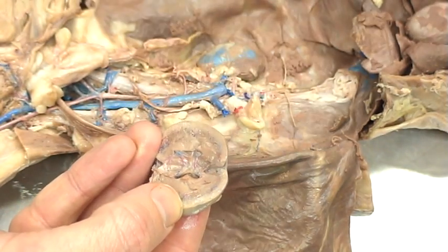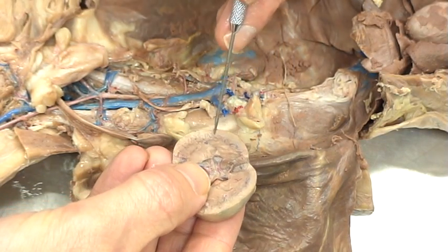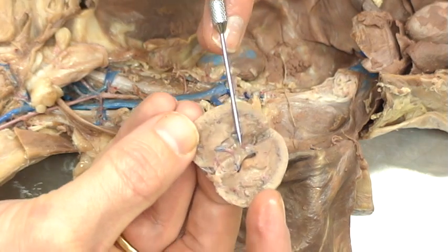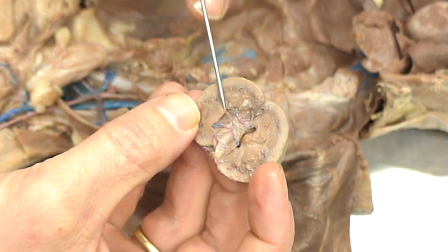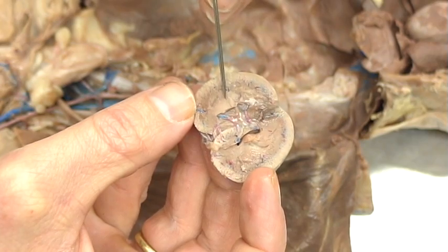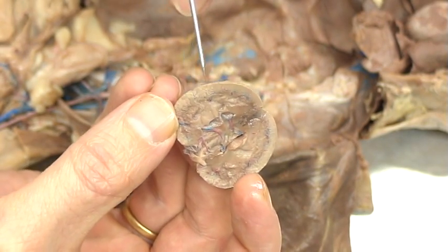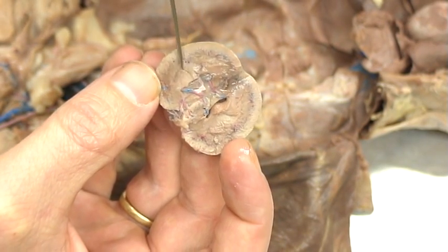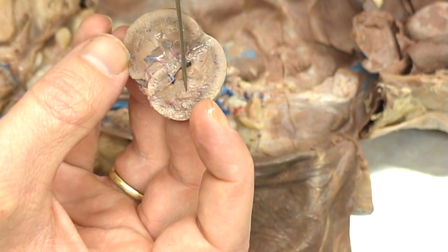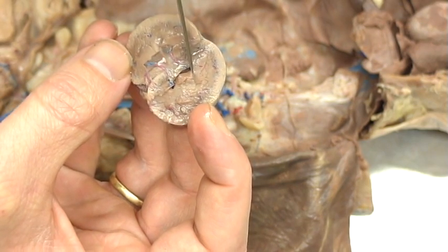There's the inside of the kidney. You can see a light region — this is the cortex. This is the medulla on the inside, and you can actually see where the renal pelvis is. Sometimes you need to allow the kidney to dry a little bit, but you should start to see some little pyramids. Here's one distinct one right here. At the base of each of those, we're going to find a calyx going into the pelvis.